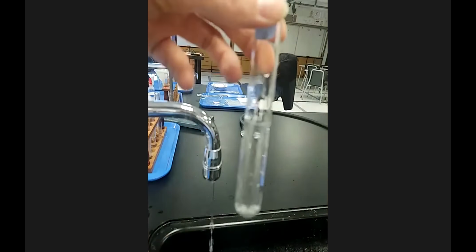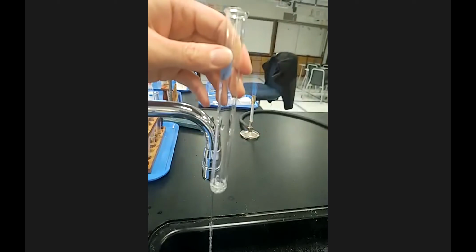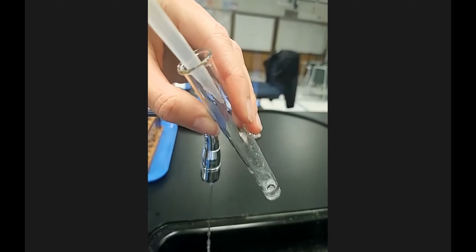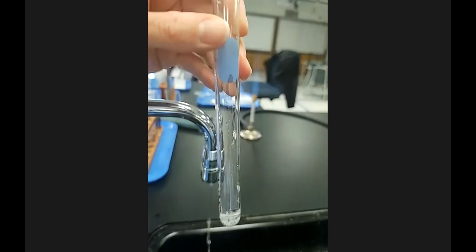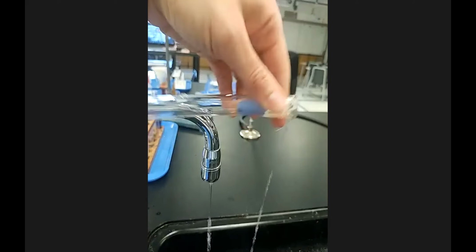And then if you guys were doing this, after you've rinsed it a couple times with tap, rinse it with distilled and pour off again most of the liquid. And now I'm going to add, and I was just doing it to make sure I had a full rinse. Now this, again, pouring off most of the liquid.